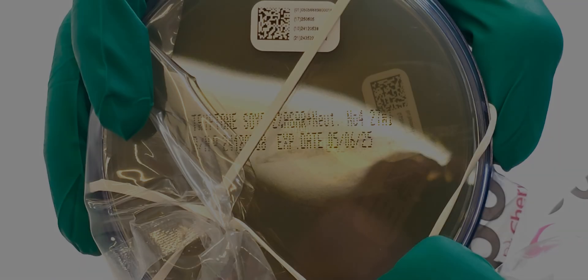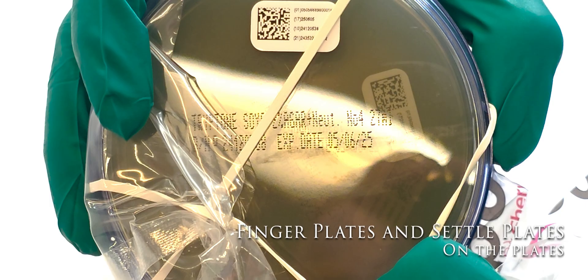Before you use any media, always remember to have a quick check of the expiry dates. Here are where the expiry dates can be found.